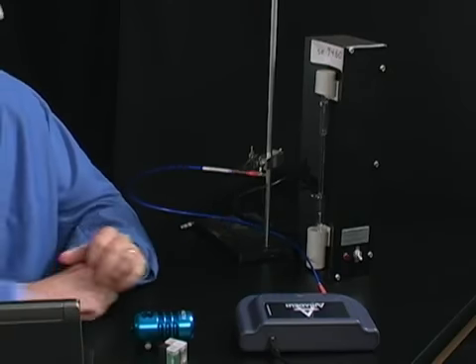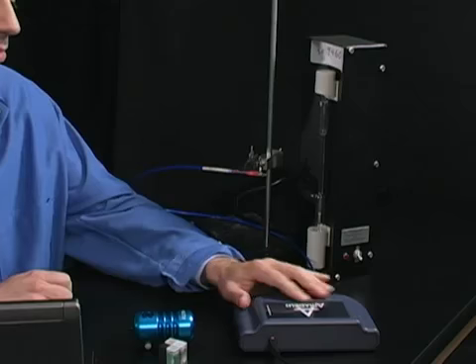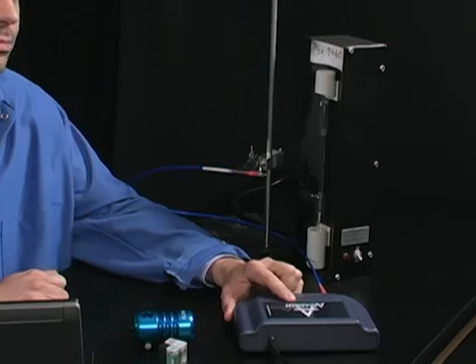So, a spectrometer is essentially a very fancy prism or diffraction grating, and it takes light and separates that light into its various wavelengths, and it can measure the intensity of those wavelengths, and that's where it gets interesting for us. So let me show you how we can use our introductory Amadeus spectrometer from Ocean Optics, and we can use that in a chemistry setting.